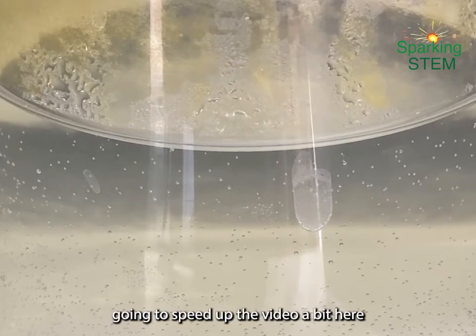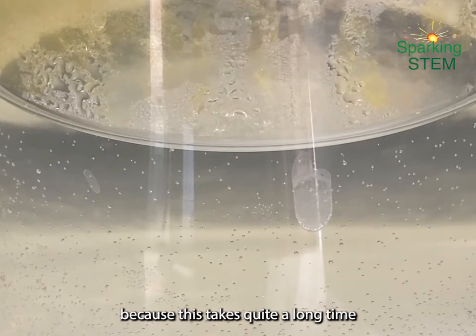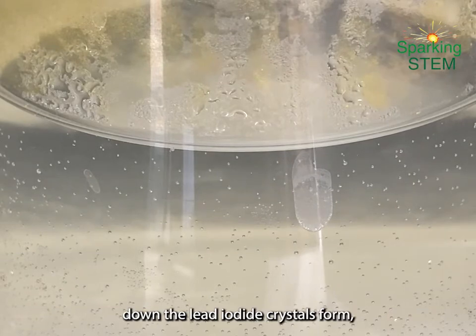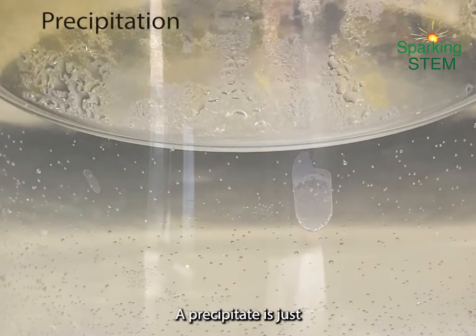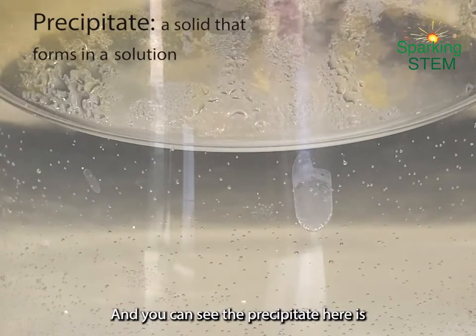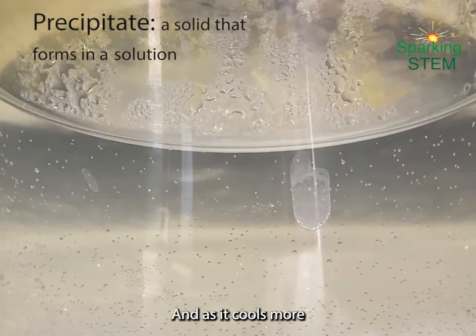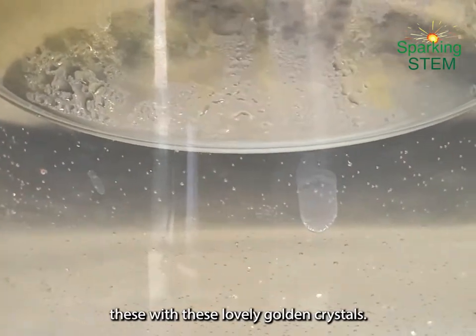Now I'm going to speed up the video a bit here so that you can see what happens, because this takes quite a long time to happen. As the solution loses heat energy and cools down, the lead iodide crystals form. We can call this a precipitation. A precipitate is just when a solid is forming within a liquid, and you can see the precipitate here is these crystals of lead iodide. And as it cools, more and more of these start to form until it looks like it's raining with these lovely golden crystals.